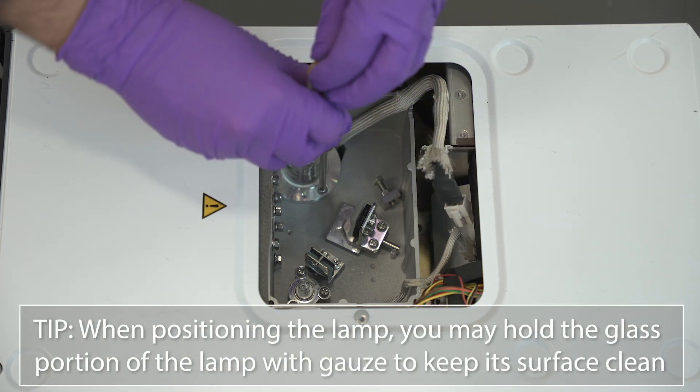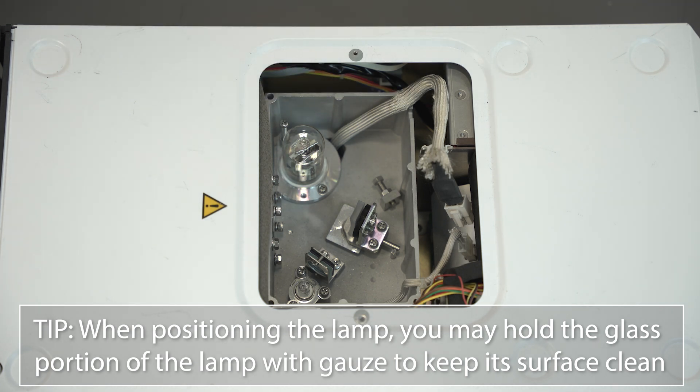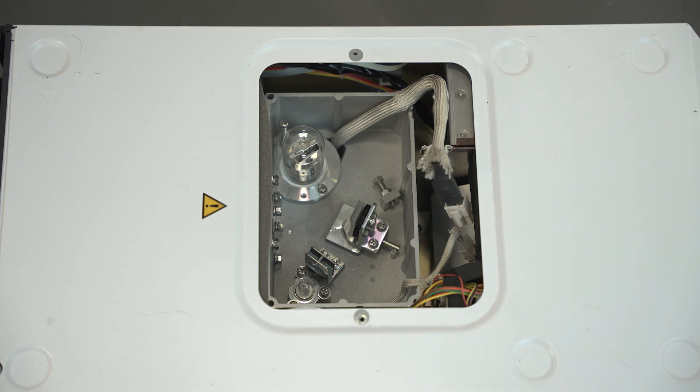When positioning the lamp, you may hold the glass portion of the lamp with gauze to keep its surface clean. Do not touch it directly. Tighten the lamp mounting screw with the Phillips head screwdriver alternately.